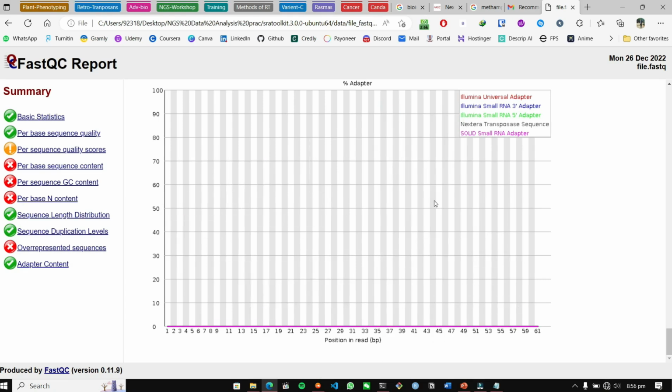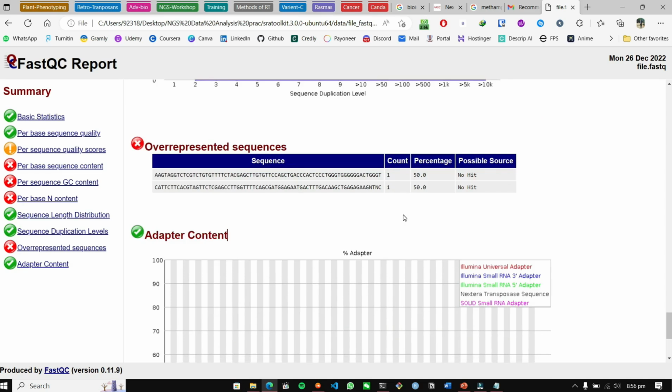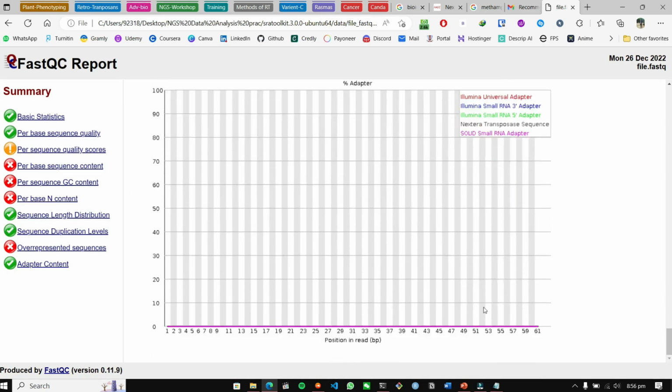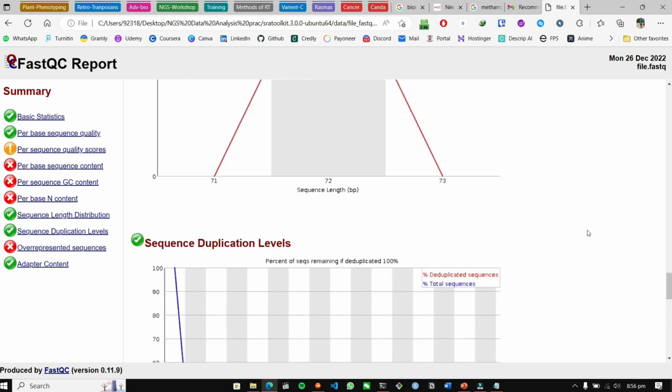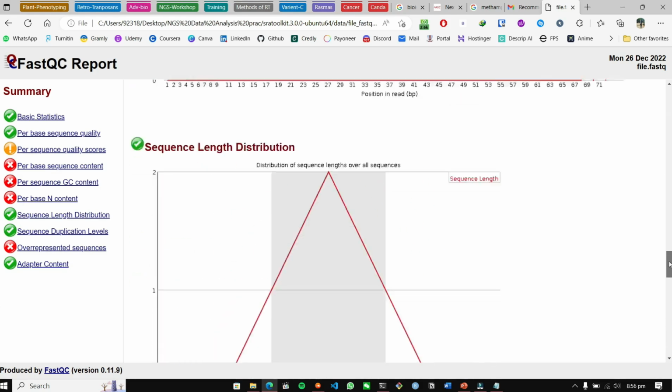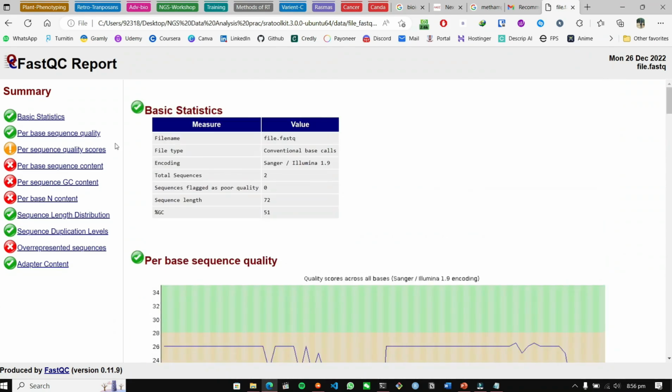And for adapters, there were no adapters found, so we don't need trimming, but we are going to do trimming as well, because we're going to use this pipeline on your data. So you need to know how to apply the trimming process to your FASTQ file. So that was it for the FastQC report. Now you know how to check the quality control of your data, and that was it for this lecture as well.